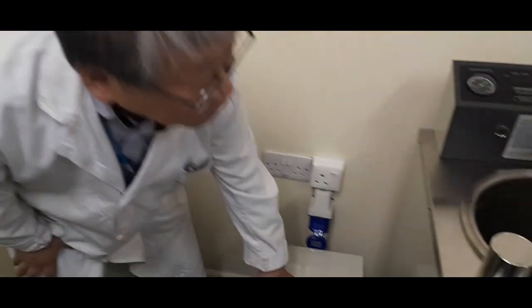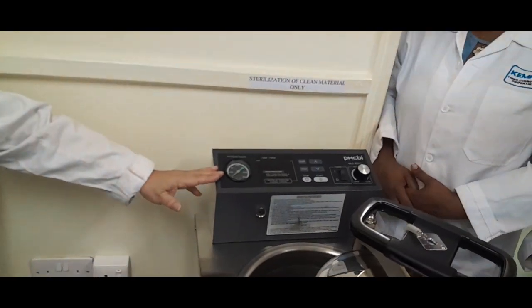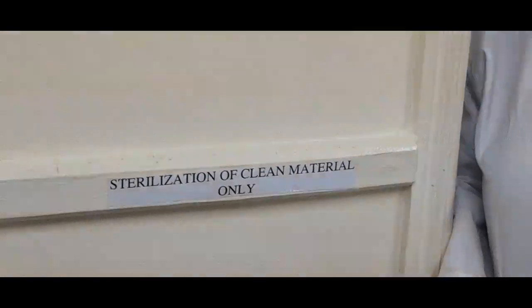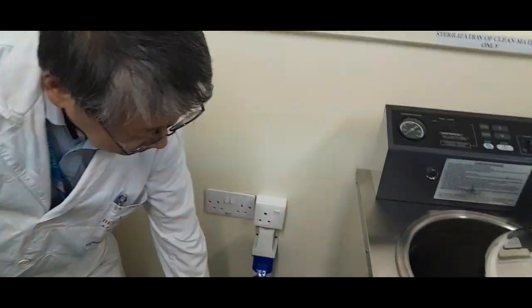That's why, to avoid that, we connect the AVR, so that the AVR tries to maintain a stable voltage. If you use the AVS, of course AVS can protect the machine, but the machine will stop running. Okay, so that means the sterilization will end in an incomplete condition. No, it's not good. That's why we use the AVR instead of AVS. Ice making, even if it sometimes stops, is still okay, but the autoclaving should never be interrupted. That's why we use this.